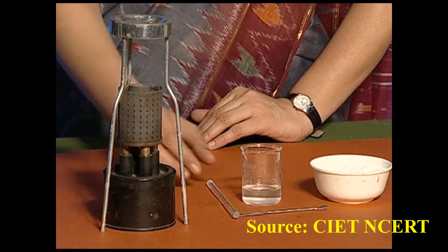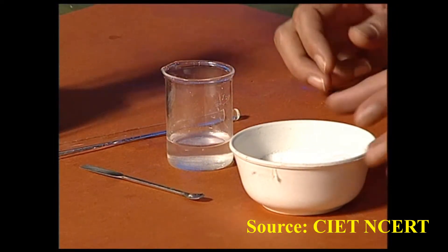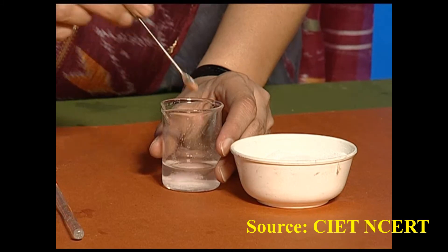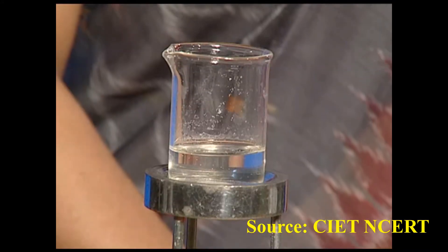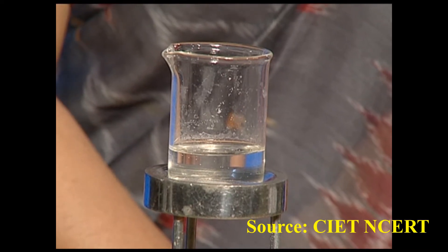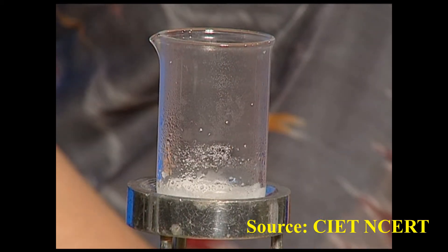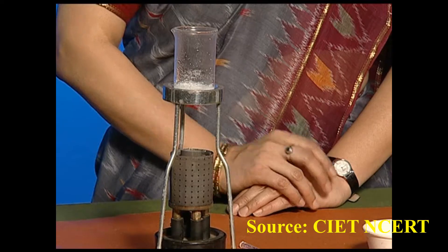For the experiment we need a burner, glass rod, beaker with water, salt, and a spatula. Using the spatula, salt is added into the beaker and the glass rod is used to mix the salt with water. This salt solution is then kept on the burner for evaporation. Due to the heat, the water starts to evaporate, and after some time only the salt is left. We have successfully separated the two substances by evaporation.